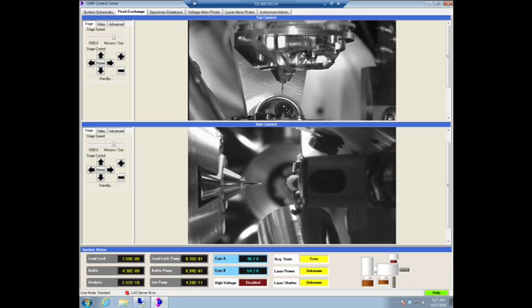So if that was to happen, it can partially be because it didn't align the transfer rod properly, or what happens very often is if this was moved to the side, so the last person doing the experiment might have had a sample that was a little bit bent and went out to here, or out to here, and they've moved the whole thing a little bit up. It just goes back. It doesn't go lateral, okay? So the most common error when things get stuck is that the stage is up here or somewhere up here and not right in the middle.